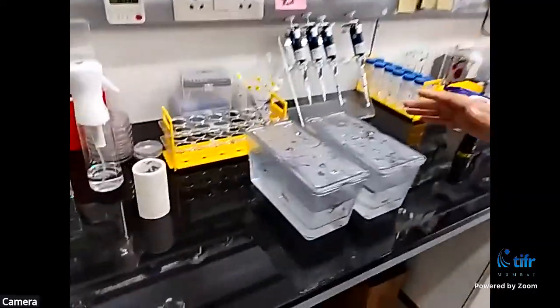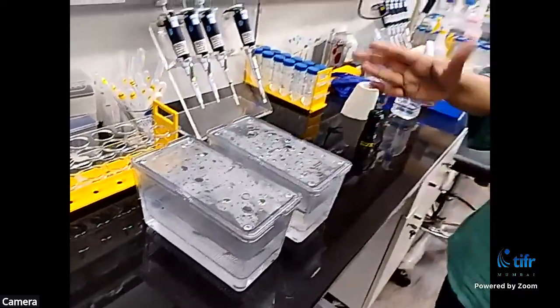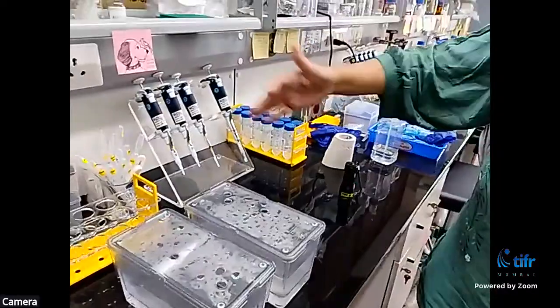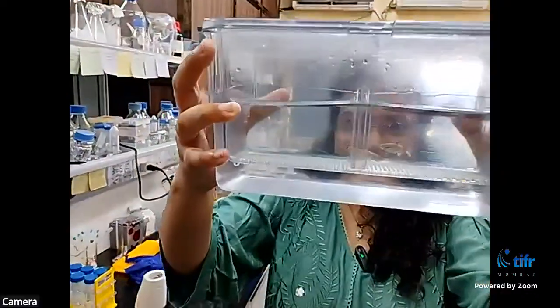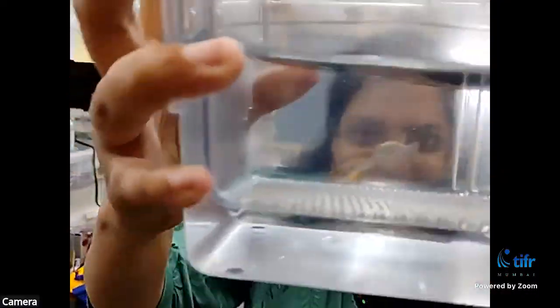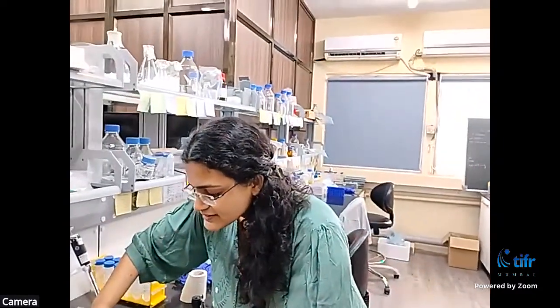Right now, you're already in our lab, and we have workbenches over here where we do our experimental work. Where's the zebrafish? The zebrafish are right here. Actually, we have a whole facility with hundreds of tanks where these are housed. For this purpose, we have just brought a couple of tanks. Can we lift the tank and bring it in front of the camera? Okay, so these, where are the fish? We will again be showing you these and explaining things in greater detail.